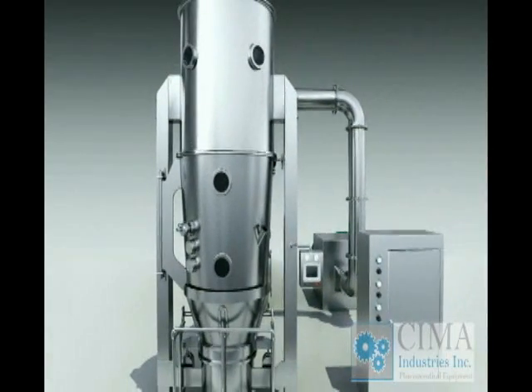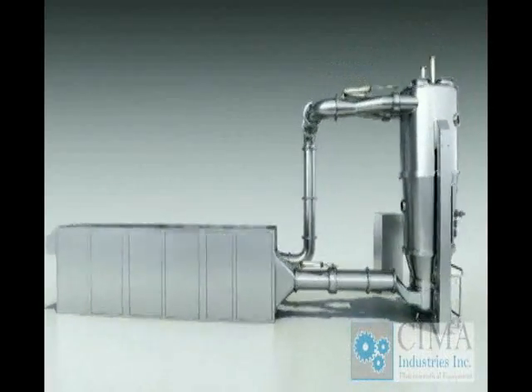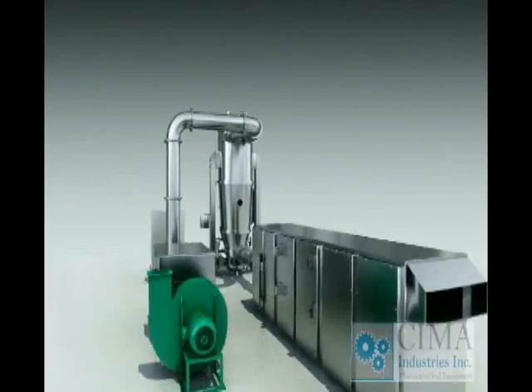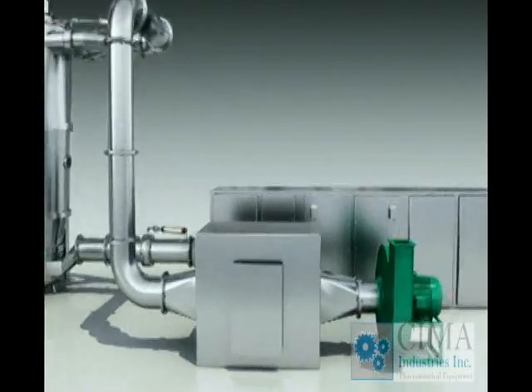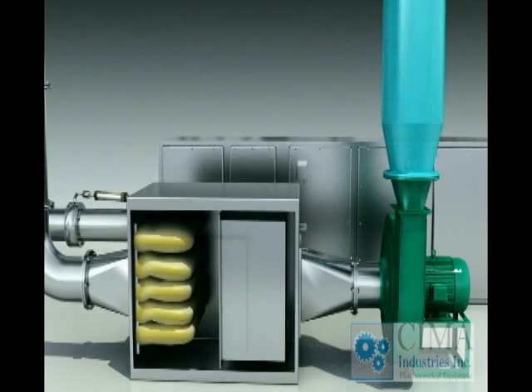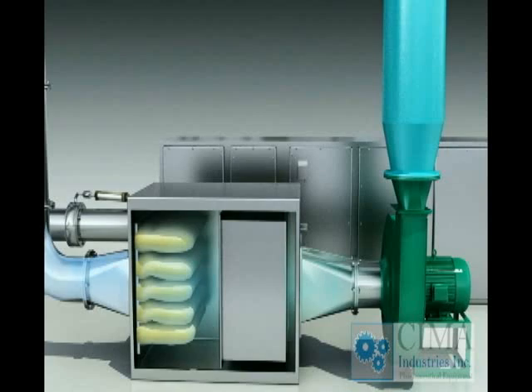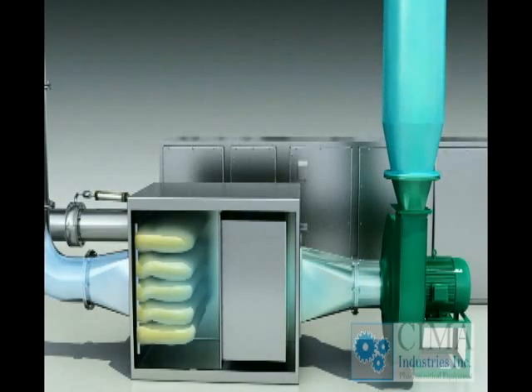Air exhaust system. Air exhaust system is normally placed in the technical room or auxiliary machine room. Construction material that can reduce noise is normally used for this room. The shock reducer under the fan should protect the fan from vibration as well as the floor of the building. For protection of the environment, post-filter, HEPA filter, or cartridge filter for exhaust air are available on request.